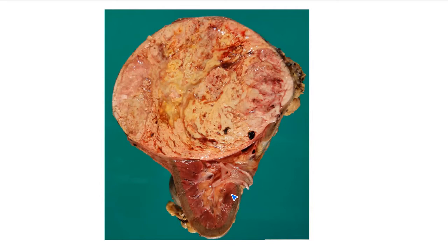I see that Kyle said kidney. Danae also said kidney. So I agree with those answers. Matthew, do you appreciate that it's a kidney now? If it is a kidney, what structure do you think this is that has been cut? It would normally be longer. It has been cut here. The ureter? Fabulous, yes, that's the ureter. So we have the lower pole of the kidney here, and then there's something happening in the upper pole.